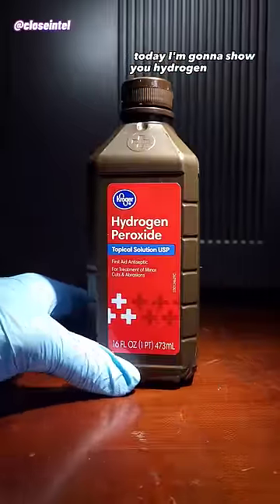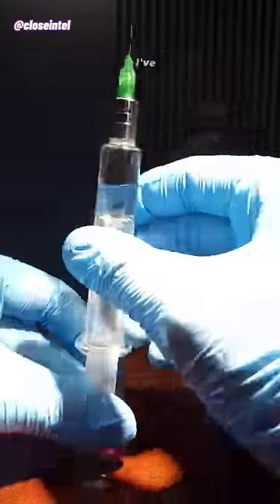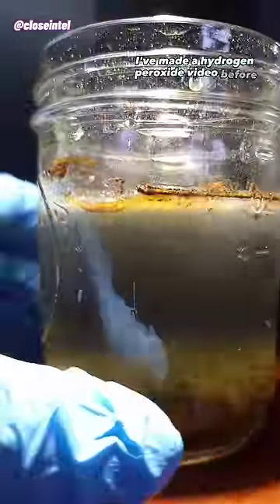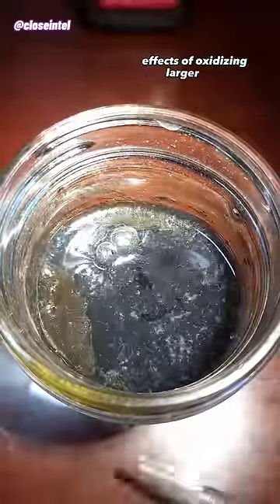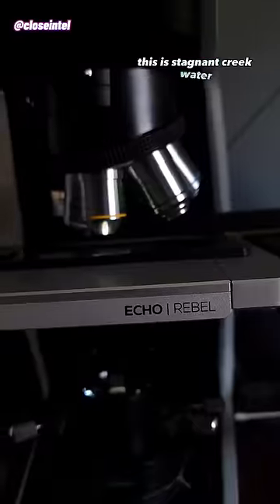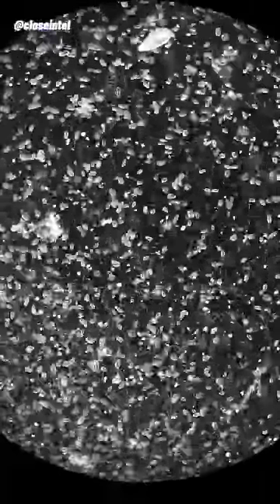Today I'm going to show you hydrogen peroxide versus bacteria under the microscope. I've made a hydrogen peroxide video before, but it only showed the visual effects of oxidizing larger cells. This is stagnant creek water that started to grow a smelly biofilm on the surface.